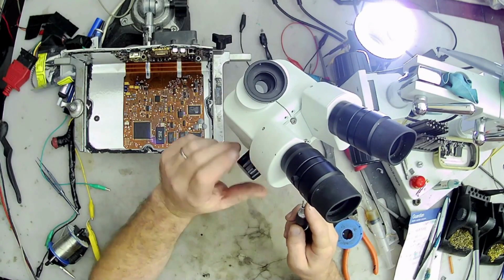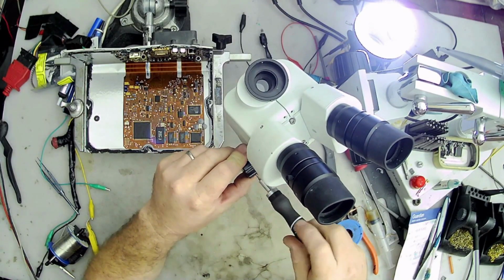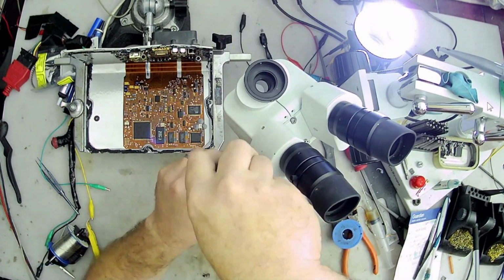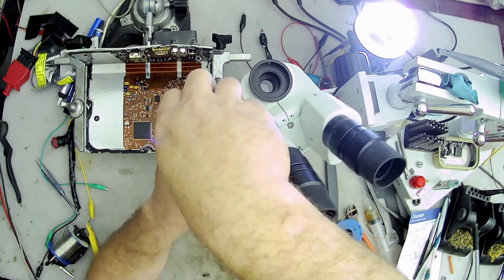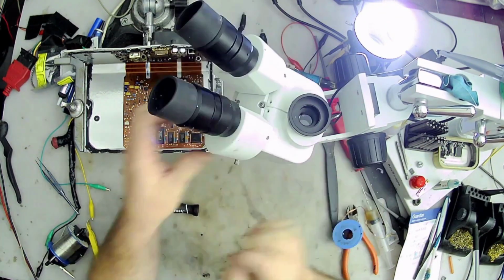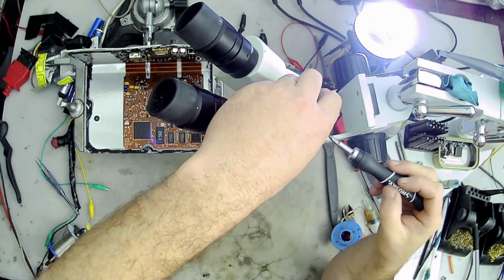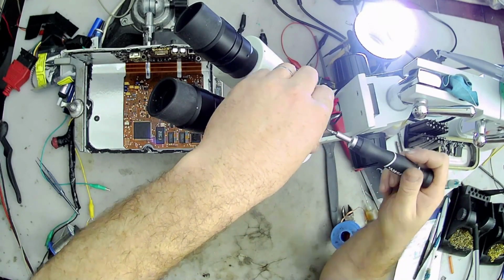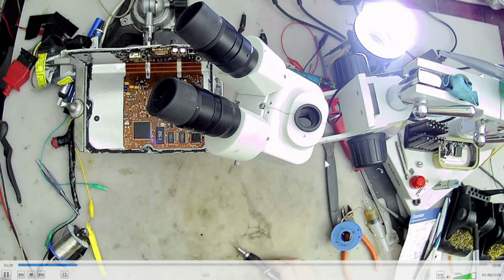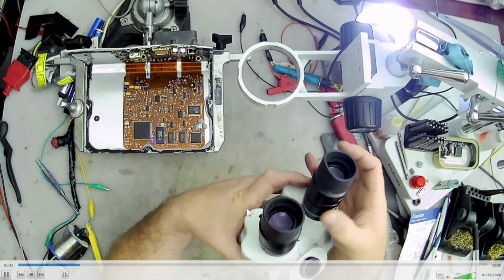And I think there might be different styles of this. I don't know. This is an Amscope one. If you don't see any holes in your knob, then it probably comes off a different way. It's probably a screwed on one or something like that. But I'm taking off the camera port here, and the knobs and the base of the camera port are the same Allen wrench.